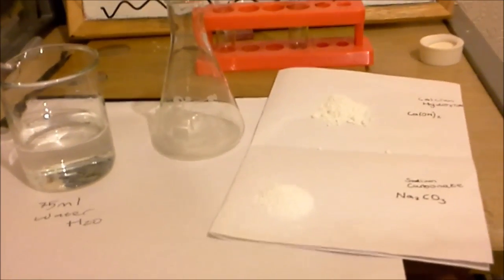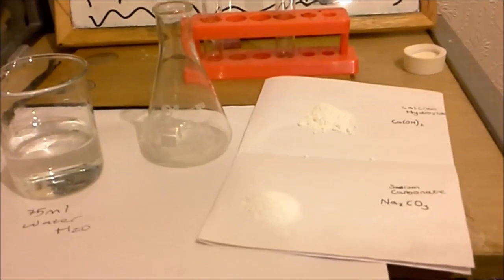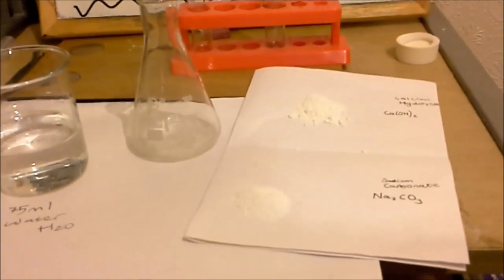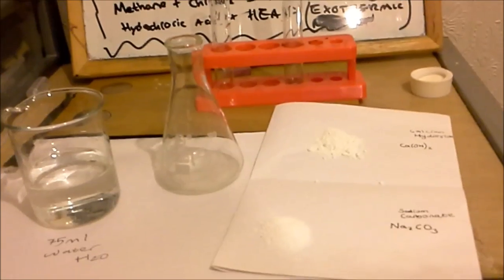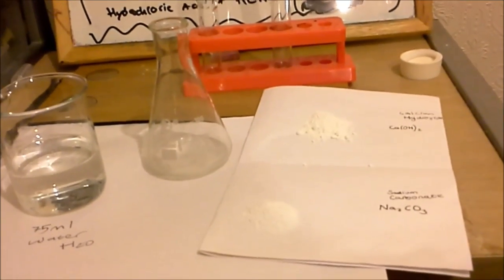Hello, in this video we'll be making some sodium hydroxide. As you can see I have some sodium carbonate and some calcium hydroxide and we need 75 milliliters of water.